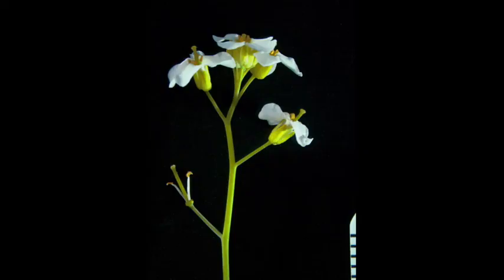Looking back at the rockcress at the lower left-hand flower here — what do you think? Does it have a silique or a silicle for a fruit?